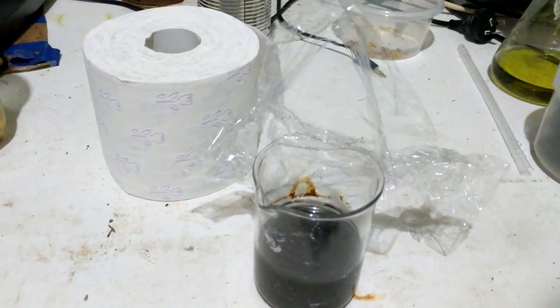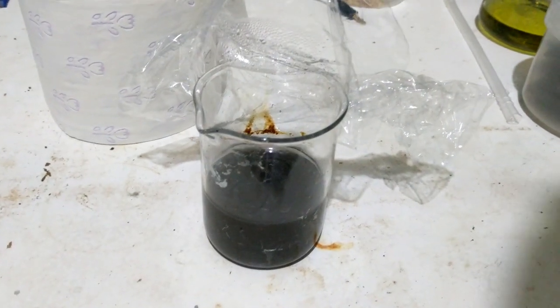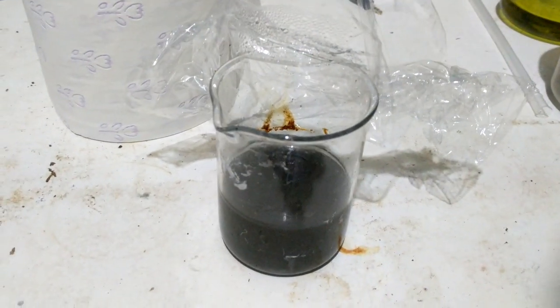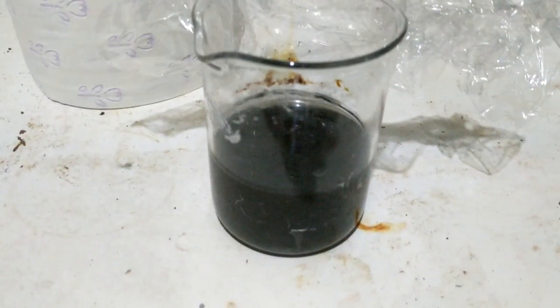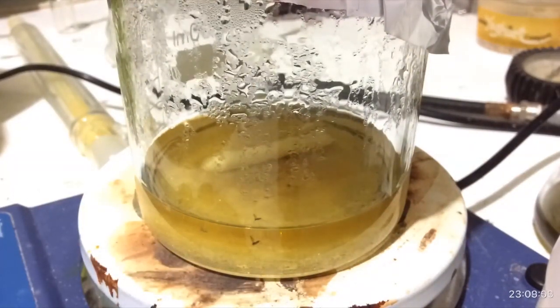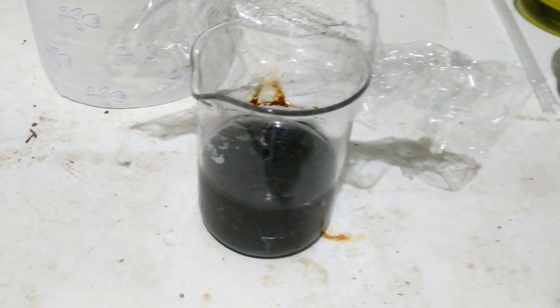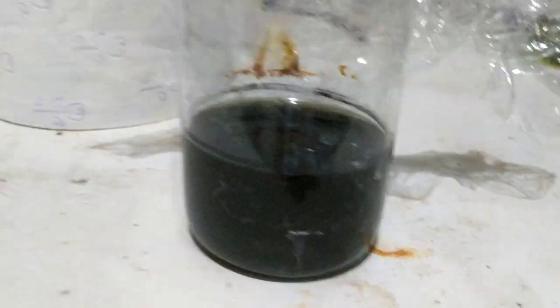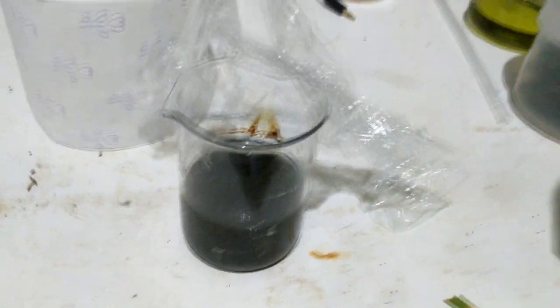I've stopped running it after about 80 to 90 hours. One thing I didn't do, which I did with the chlorate cell, was pH adjustments. Just like with the chlorate cell, you want it to be acidic to break down hypobromite into bromate and bromide. But I just generally forgot to pH adjust — it doesn't really matter for this small cell, just a little bit of efficiency you lose. I just checked the pH and we're at about 9 after all that time, which is not really too much of an issue. We're letting it cool down, and you can see crystals starting to form on the sides too. We'll put this in the fridge and should get a whole heap of material out.